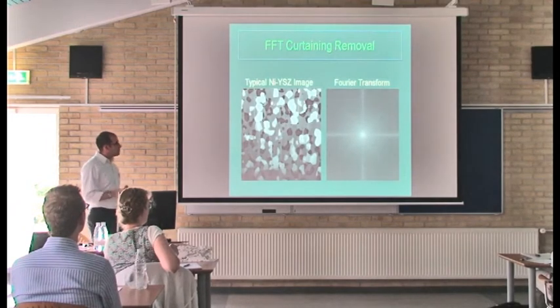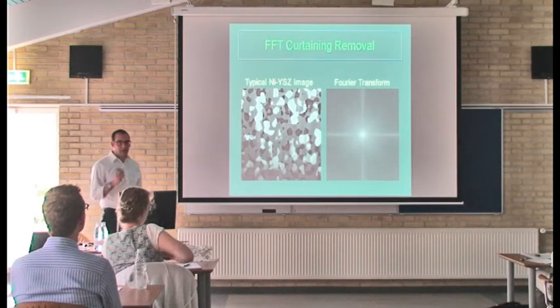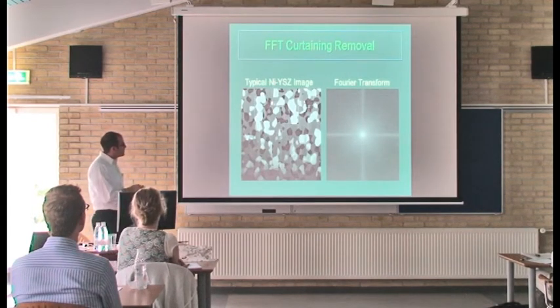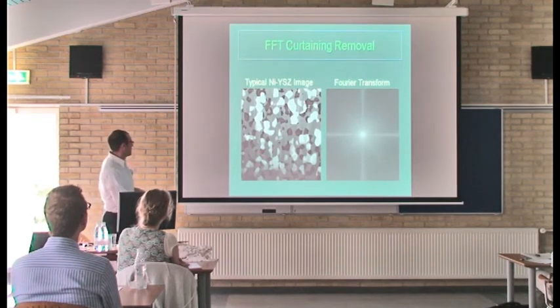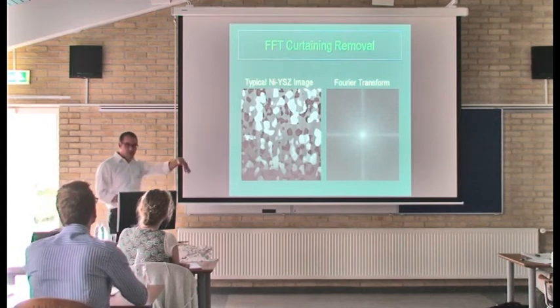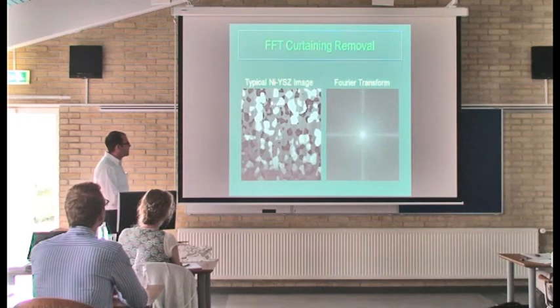This is something we've kind of been playing around with. The effectiveness of it is questionable, but it works pretty well depending on your images. But a lot of times you get these vertical stripes, which I think are visible enough for you here. It's not necessarily curtaining, but almost like a streaking from the ion beam.